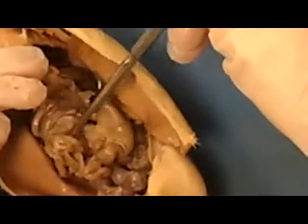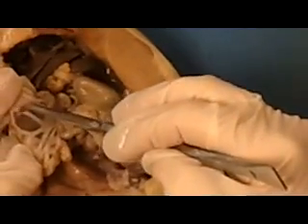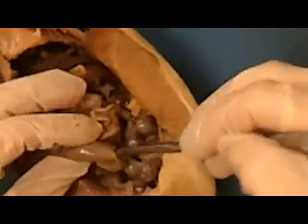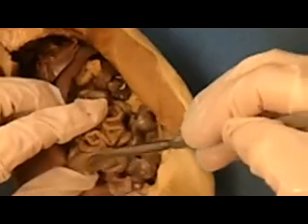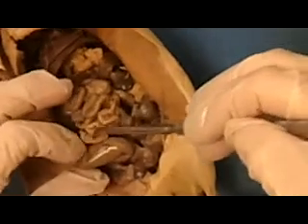Now below that you can see the small intestine. If I take the small intestine and I spread some of it out like this, you can actually see this clear material, and it's actually got veins, capillaries. It's got a blood flow that goes through it to supply the intestines with blood, and it's called the mesentery. Alright, this large sac down here that looks almost like another stomach, that's called the cecum. The cecum is actually a structure that's going to separate your small intestine from your large intestine.